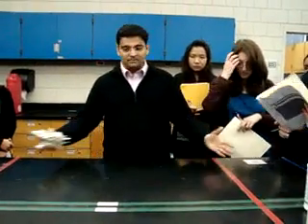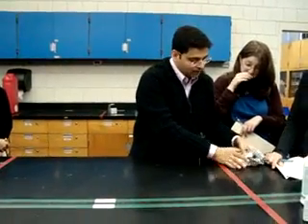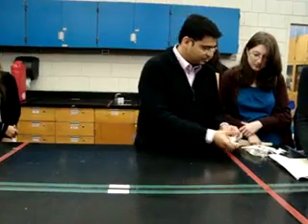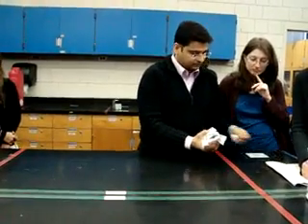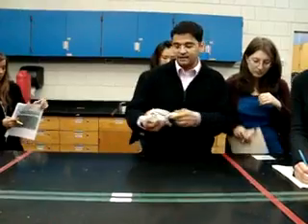This is the hood. You cannot go back and forth — you cannot do this and this and this. That's not enough. So you pick up everything in one hand, or two hands if needed, so that you have your procedure sheet over here. Then you enter the hood.